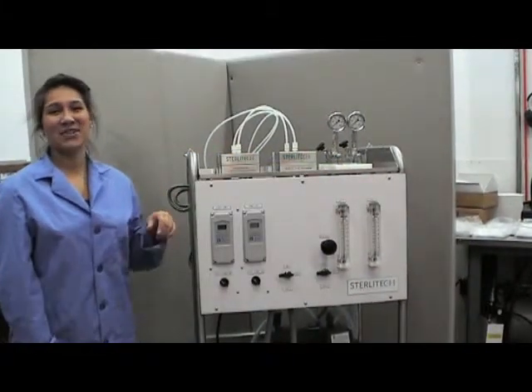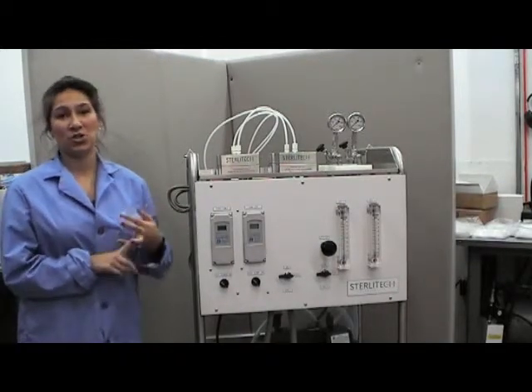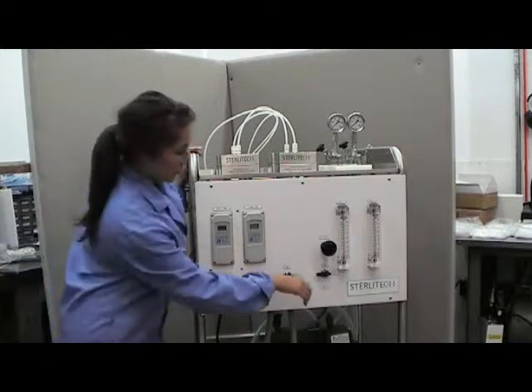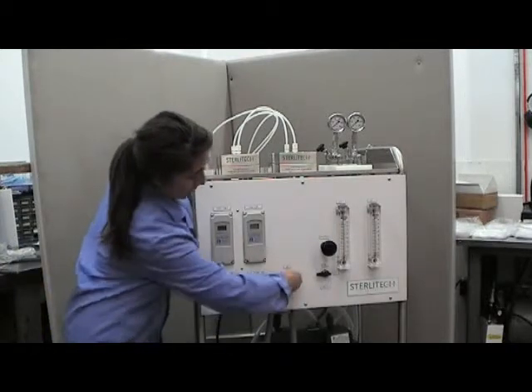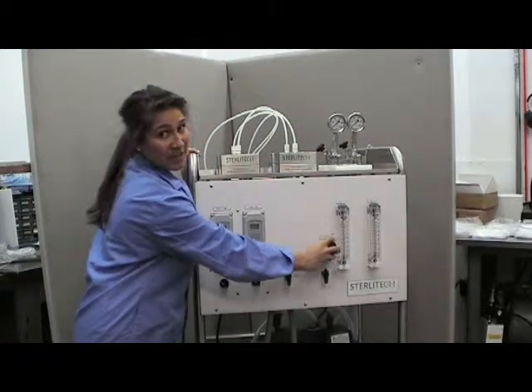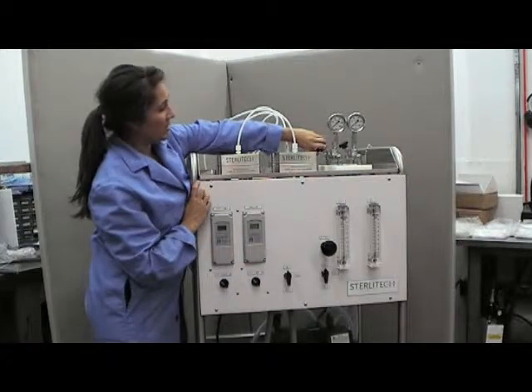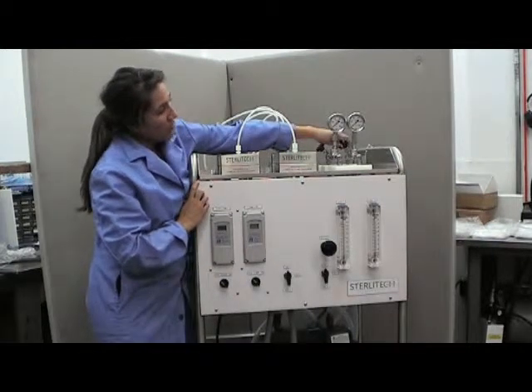Before turning the system on you'll want to start by making sure all of your lines as well as your control valves are fully open. So we'll start by turning on line one and line two, making sure your bypass valve is completely open by turning it fully to the left as well as the back pressure valves by turning to the left, both of them.